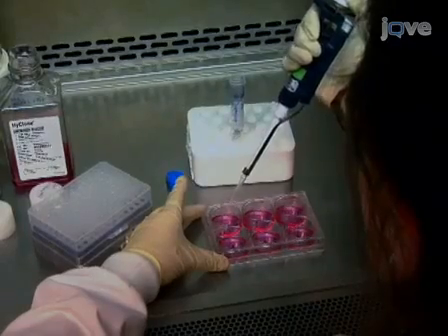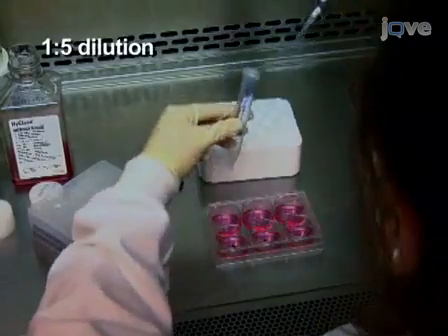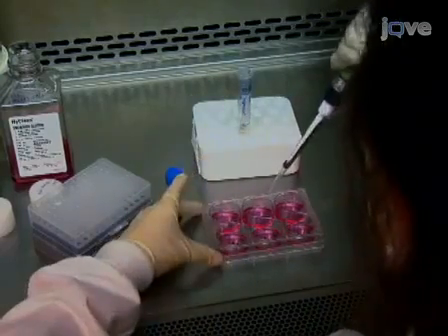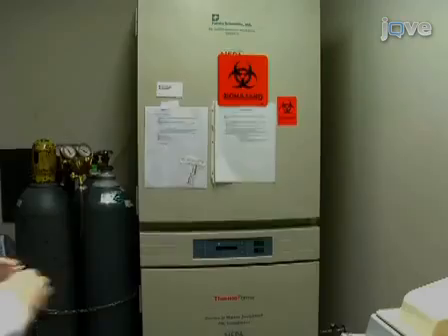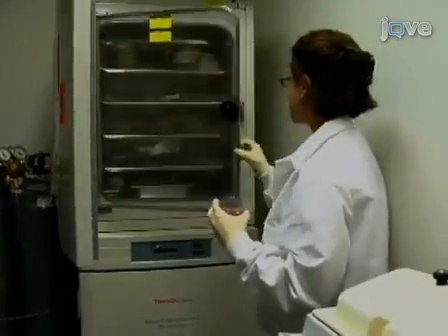Plate HEK cells seeded at a 1:5 dilution to allow isolation of 500 micrograms of protein per standard tube reaction. A single tube may suffice to identify the putative binding partners of a protein of interest by immunoblot. For mass spectrometry analysis, increase the number of standard reactions at least 10 times.